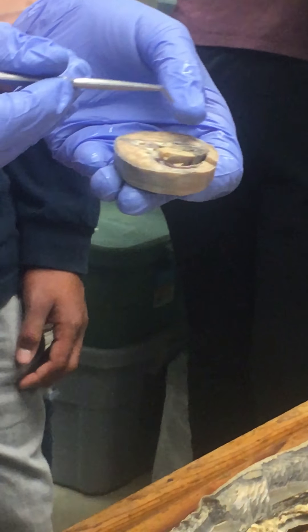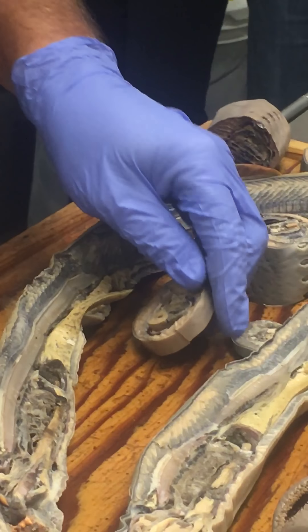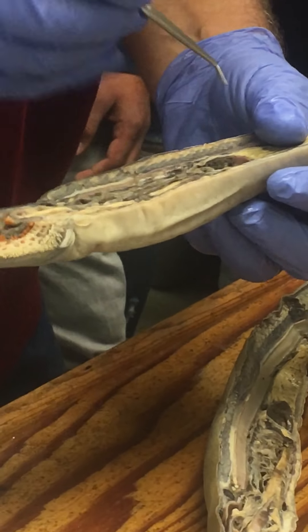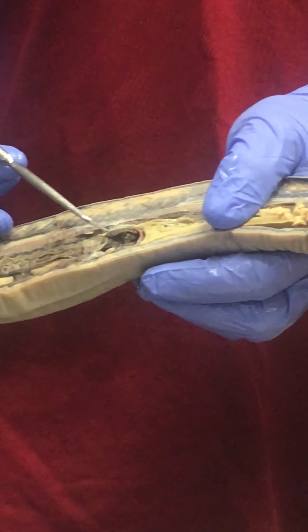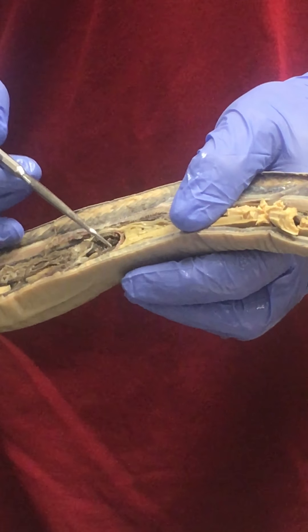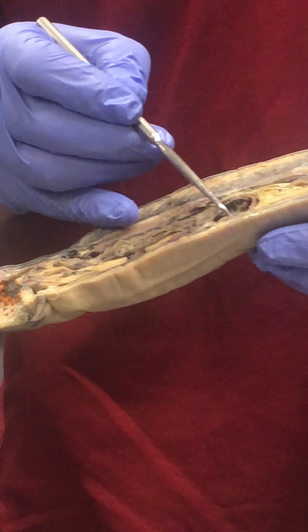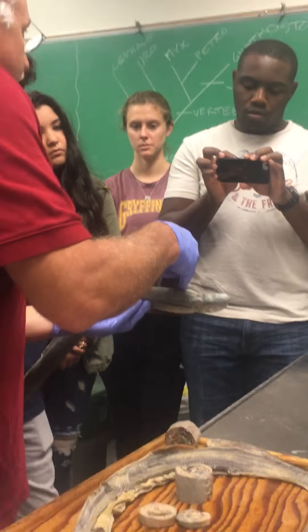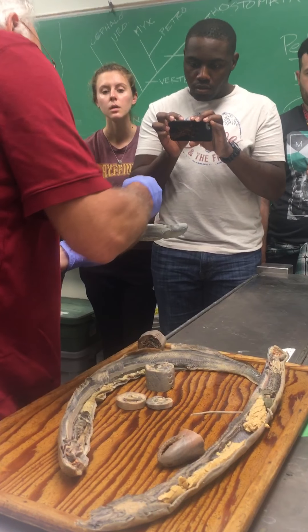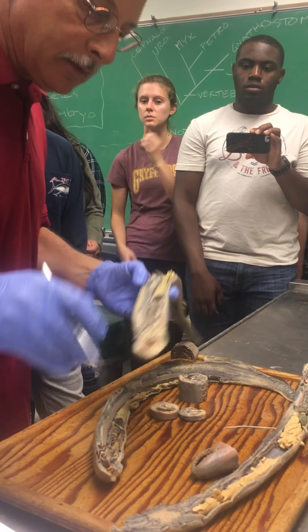There is another passage from the atrium over to the ventricle called the atrioventricular aperture. In this sagittal section you can see the atrium and the ventricle — the lighter colored — and I can poke a probe right through there from atrium into ventricle; this is the atrioventricular aperture.